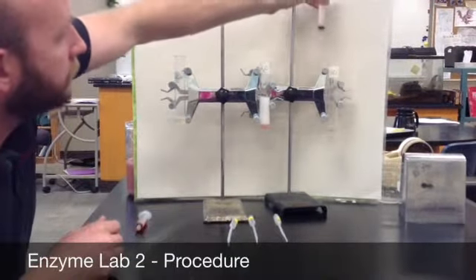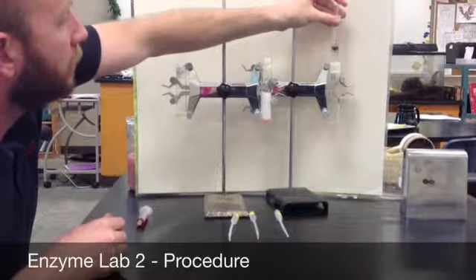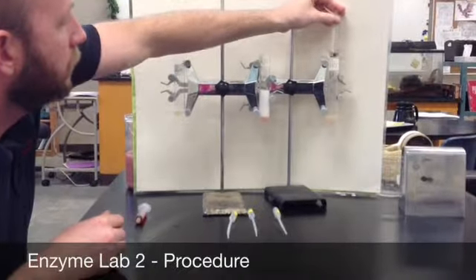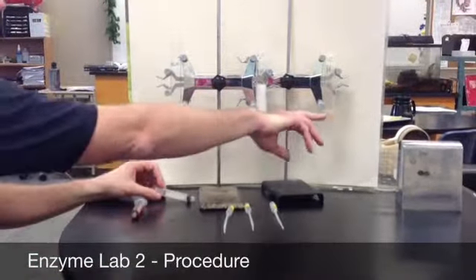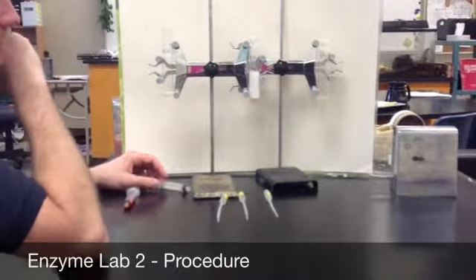And then we are going to add 2 milliliters of hydrogen peroxide to our acidic solution. And when we do, once again, we see very little bubbling, similar to what happened with the base. So basically a reaction rate of 0.